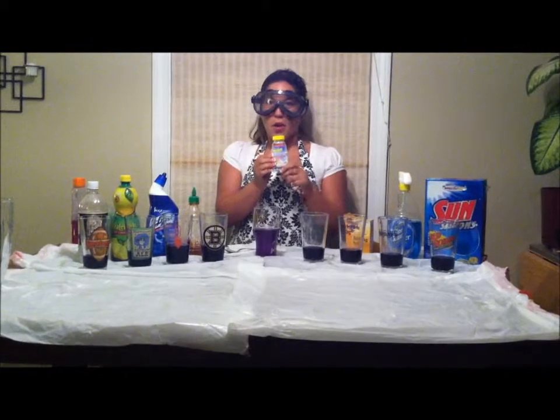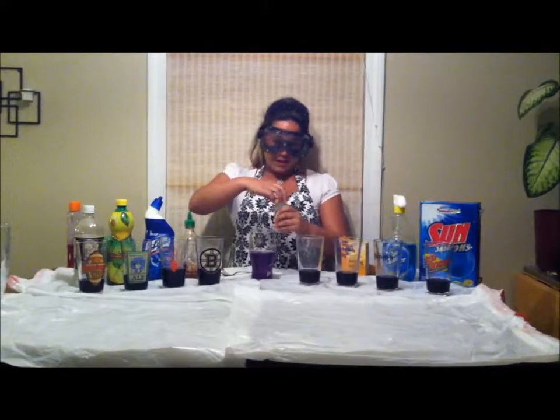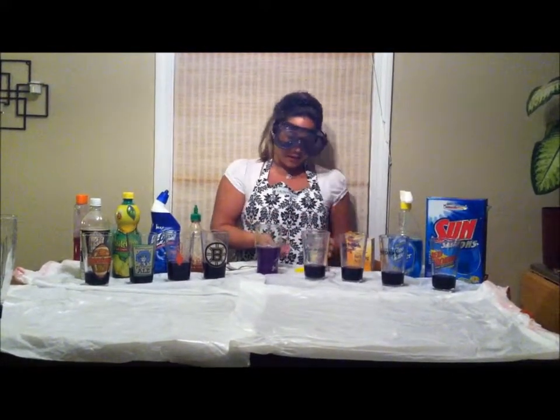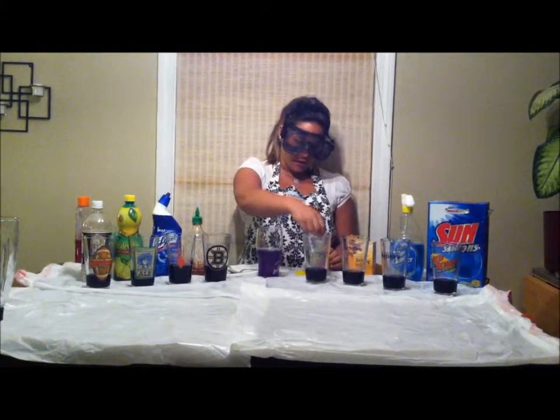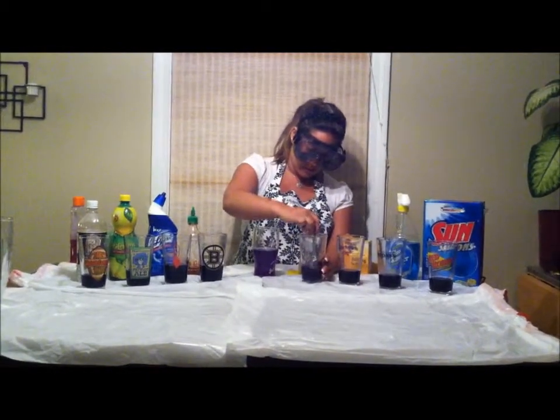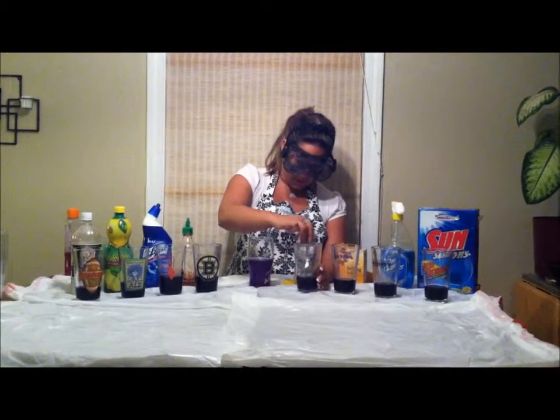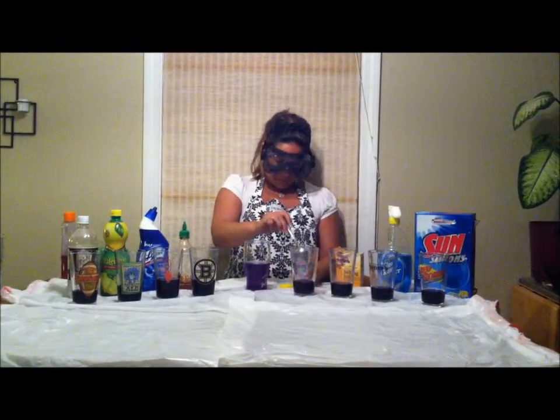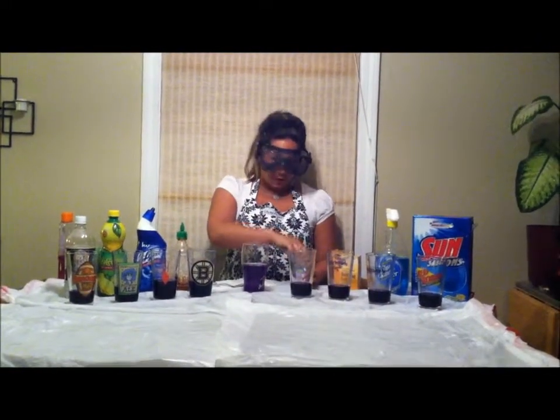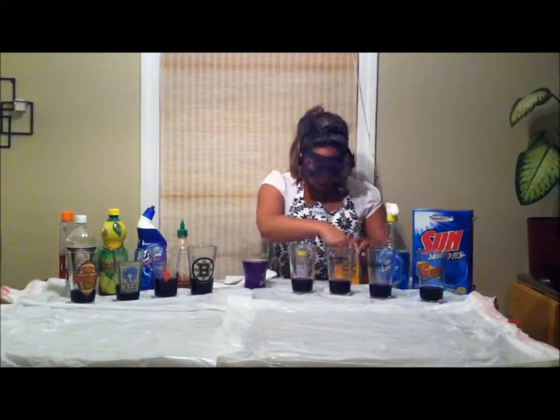We have our old antacid, for those of you that love to eat some acidic food and get heartburn from time to time. Pop one of these and it dilutes some of the stomach acid. So we're going to put 3 of them in here, stir it up a little bit, see what we get. I think you'll see a good change in a few minutes after we just let them sit for a little while. So let's just get them all set up here, and then we'll wait a few minutes and see what kind of colors we get.